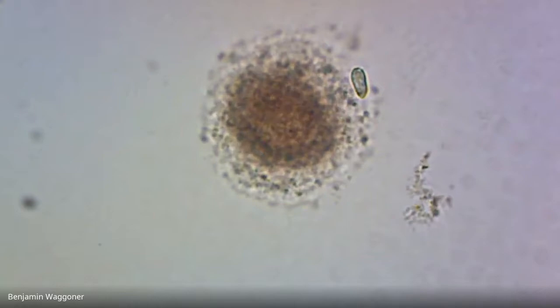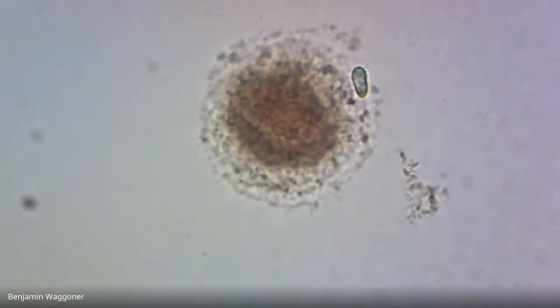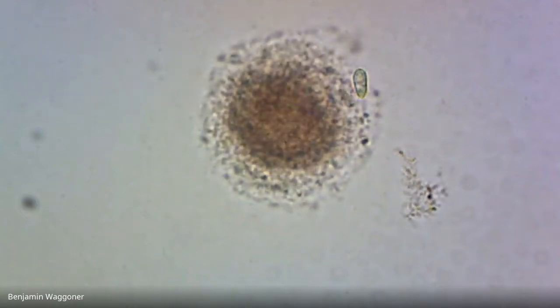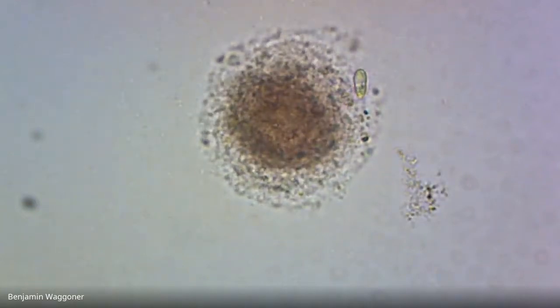So let's see what we can identify. That's interesting.